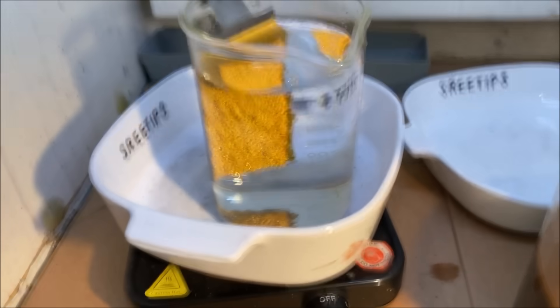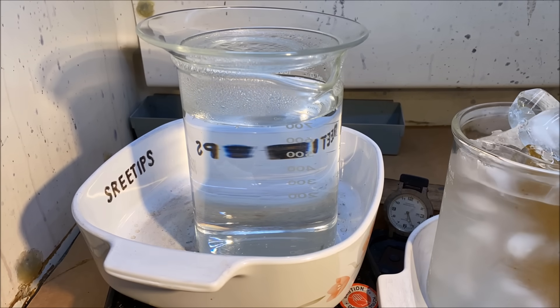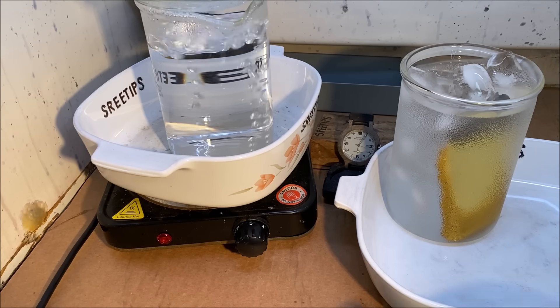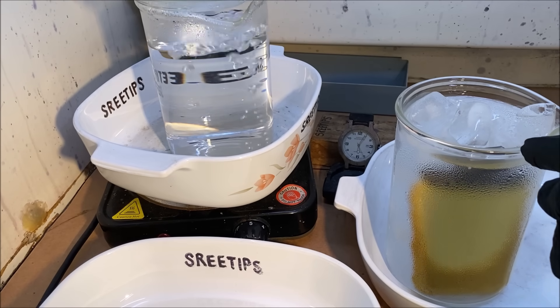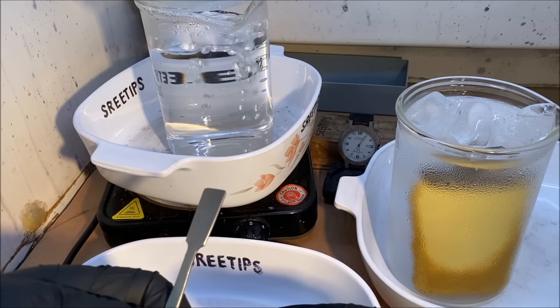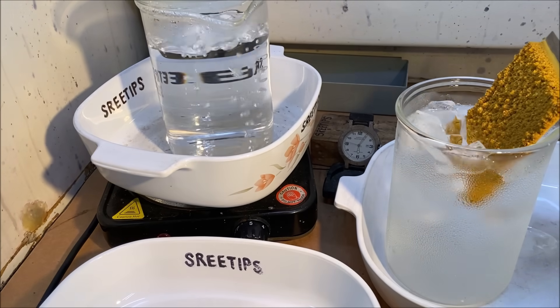We're going to heat this up now in some hot distilled water. I was going to heat the gold up and douse it in cold water, but instead I changed my mind and decided to chill the gold with ice water and then douse it in boiling water to see if I can get it off that cathode. I'm going to use a thermal differential experiment — I've got it soaking in ice water and I'm going to dip it in some boiling water. Hopefully the gold will just come off and let go of the cathode.